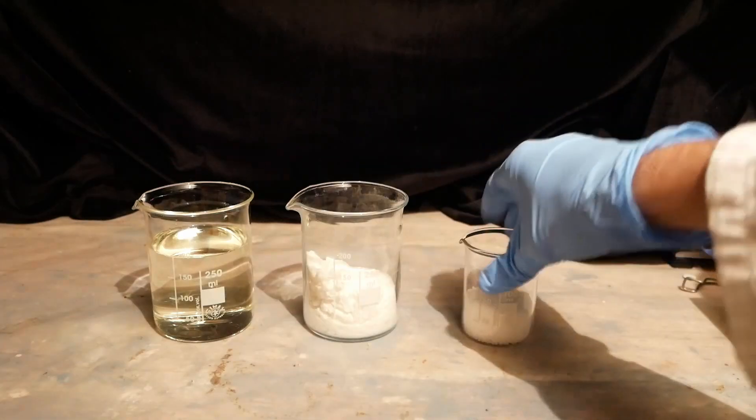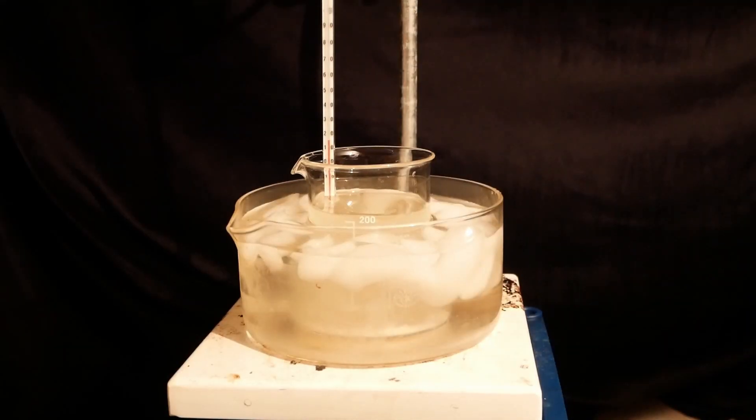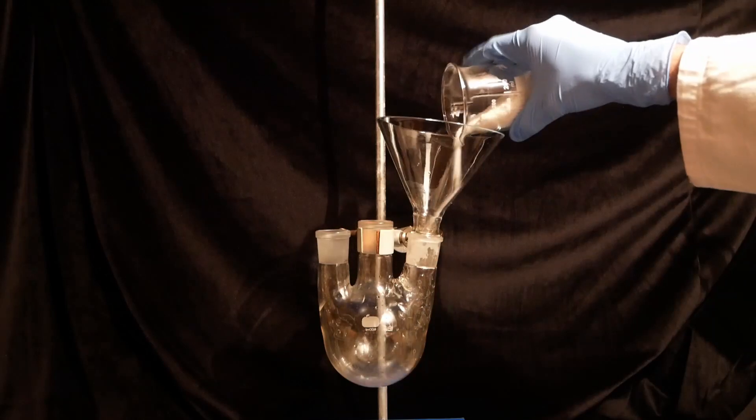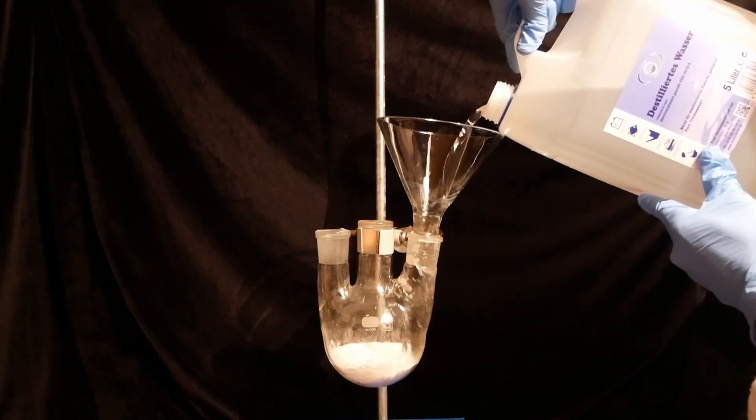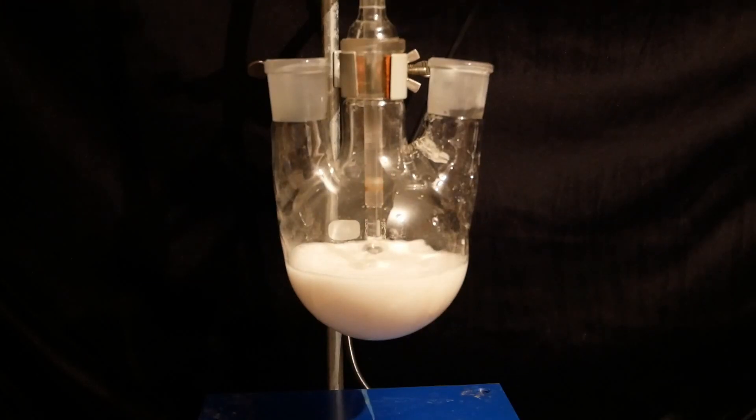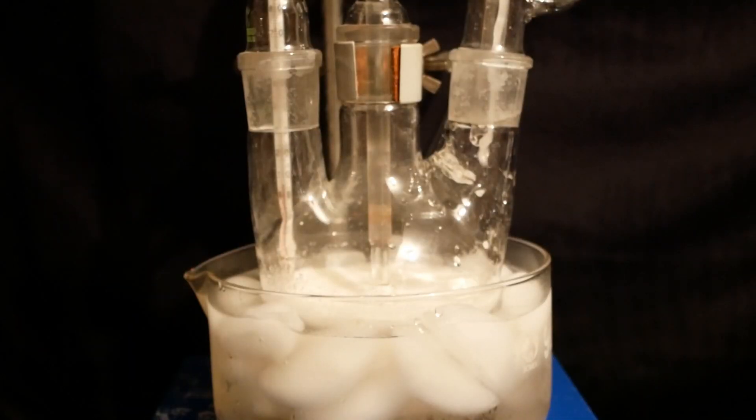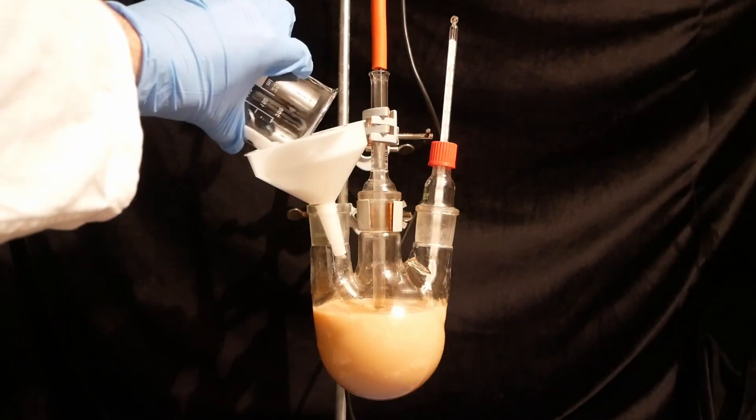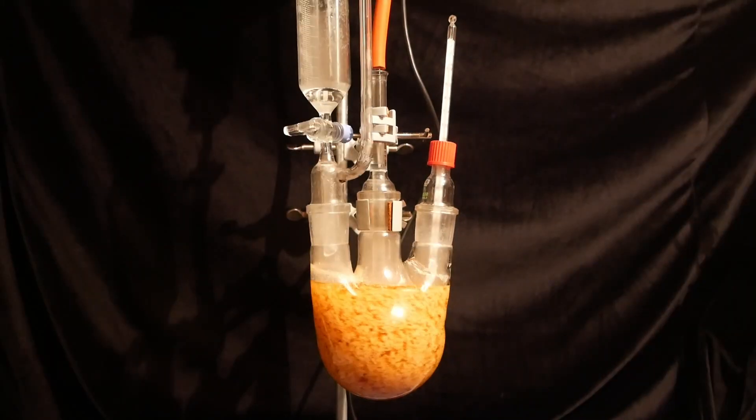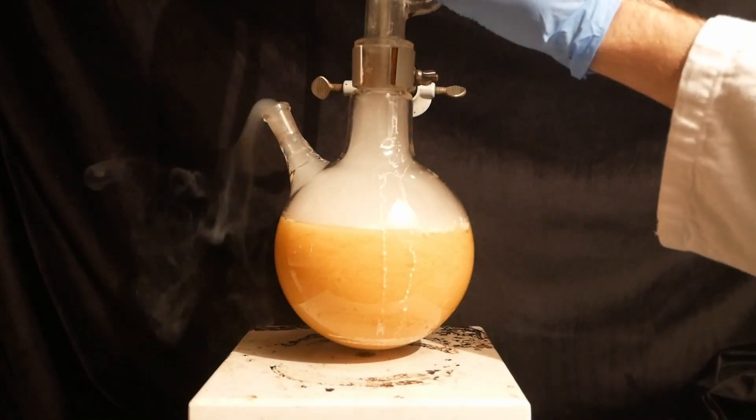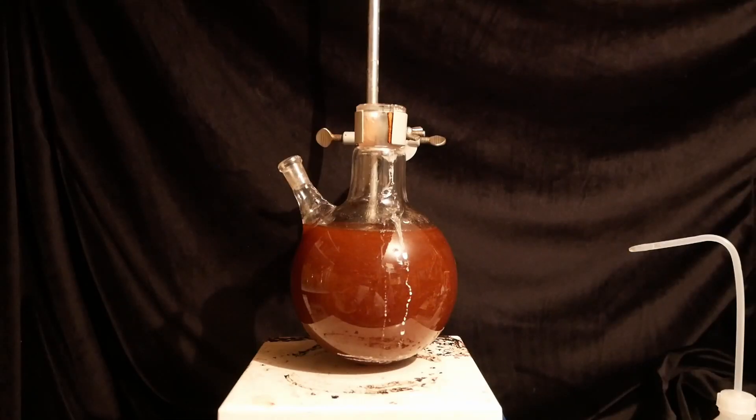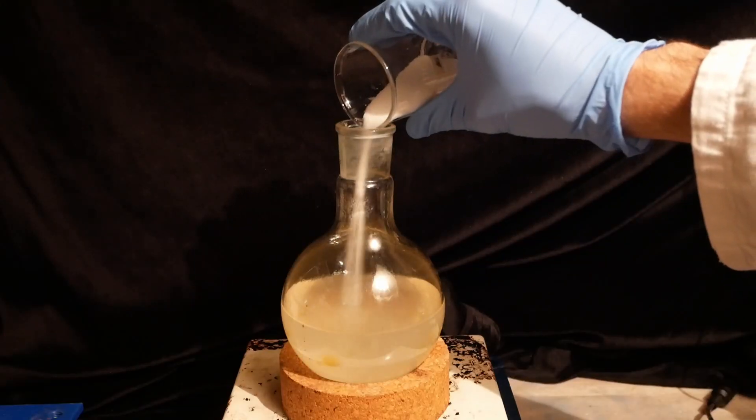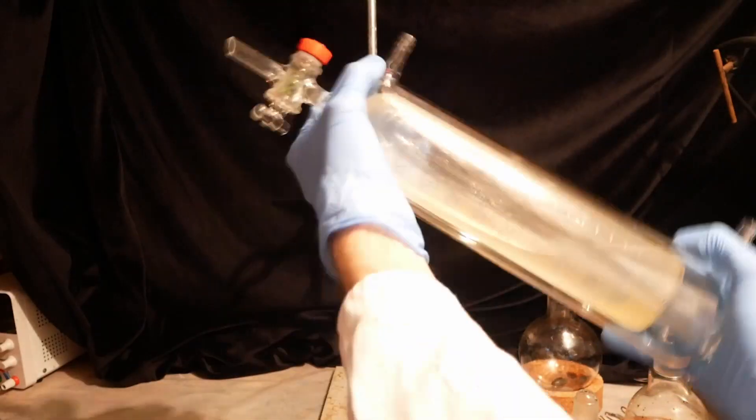So I did it again. I weighed out another batch of chemicals and dissolved the hydroxide in the hypochlorite. I suspended the benzamide in water and I also turned on the stirring to pulverize any large chunks. Then I slowly dropped in the hypochlorite solution. I let it stir overnight and heated to 80 degrees for one hour. Neutralized with sodium metabisulfite where we get those beautiful yellow flakes and acidified to pH 1. Then added sodium hydroxide solution until the pH reached 10 and steam distilled the mixture.